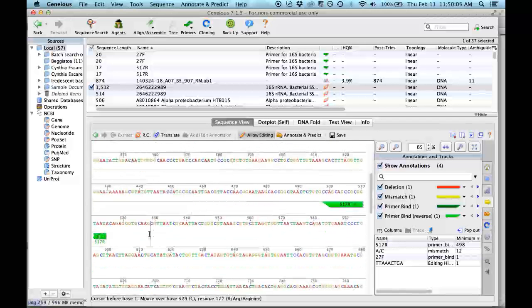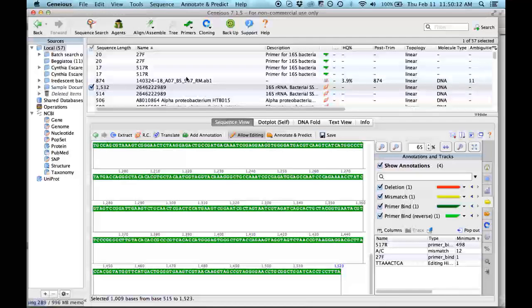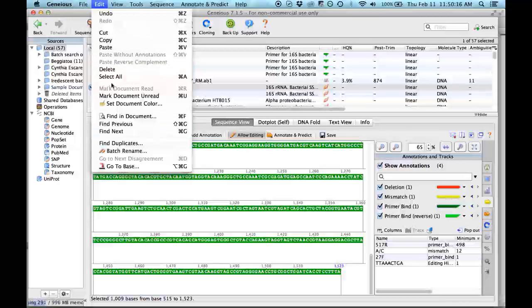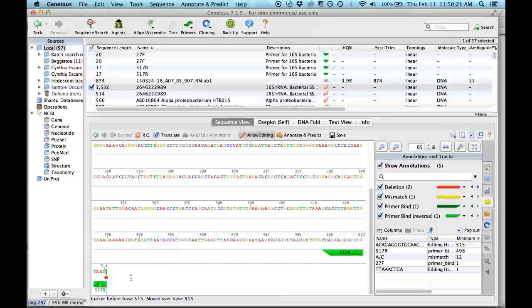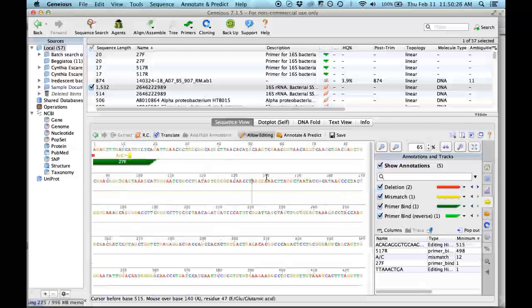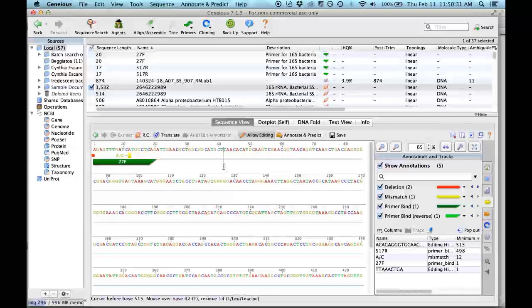So now we go here to the position of the reverse one and do the same. We edit and delete. And now we have this fragment of 514, so it's a little bigger than the one in the analysis I did before, because I really messed it up. I will Skype you and explain what I did. So now we are all set up. Here we can save it.